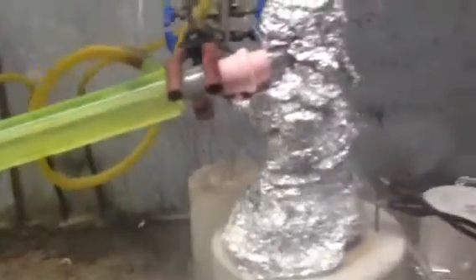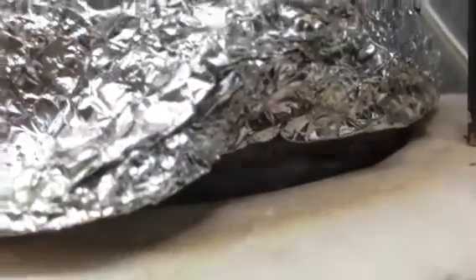I am just going to go into the fume hood here with the camera and I will show you the boiling. I will show you how it condenses on the glass and everything else.